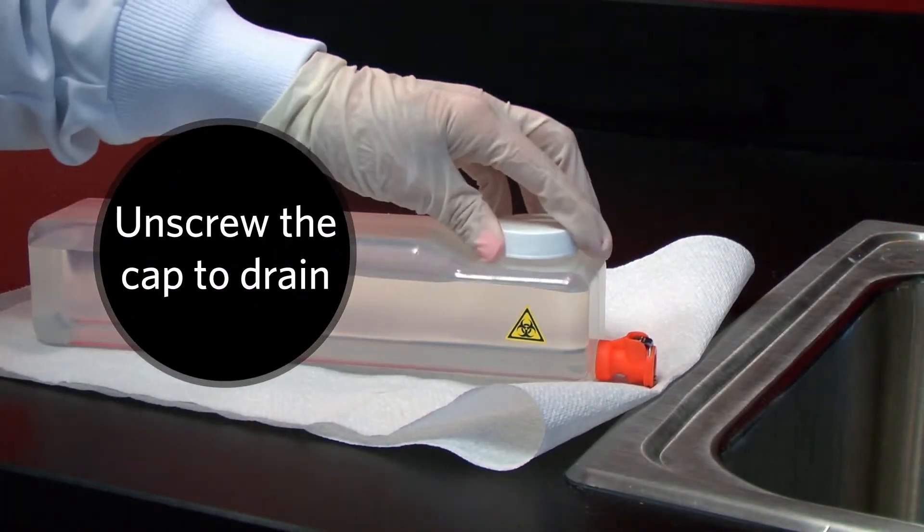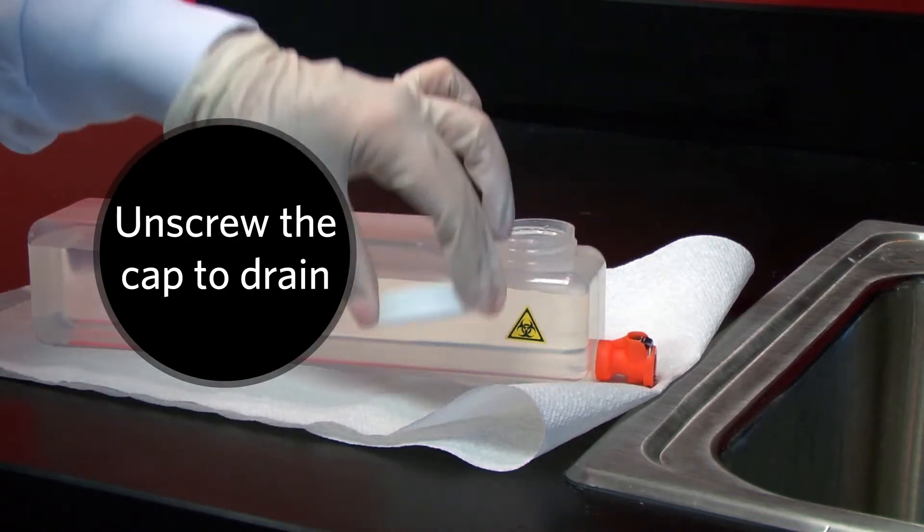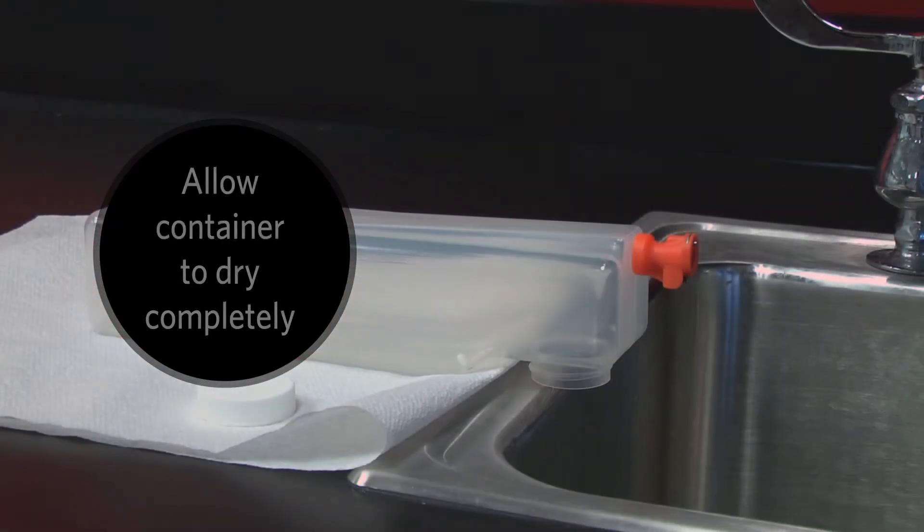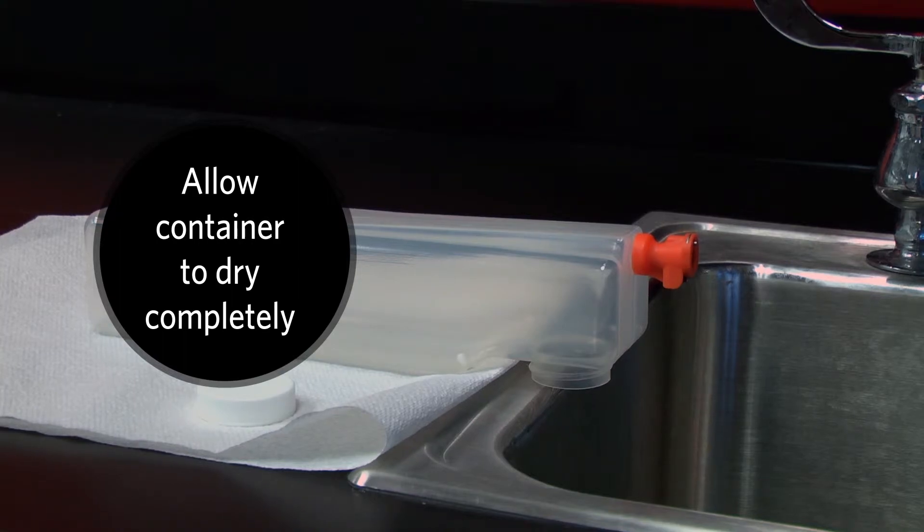To drain the waste fluid, unscrew the cap on top of the waste container. Allow the container to dry completely before reusing it.